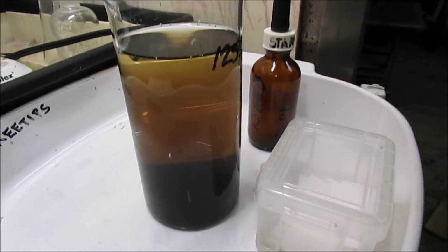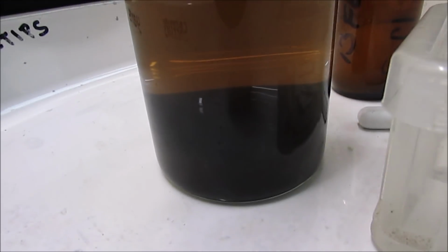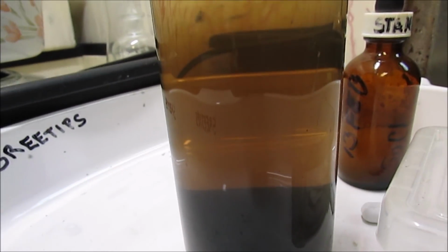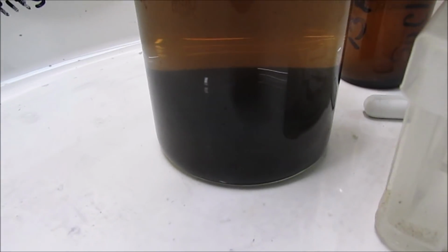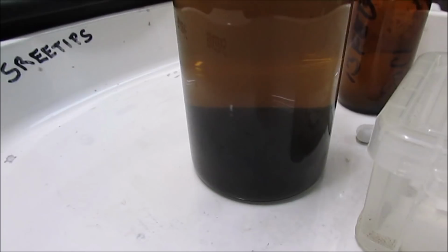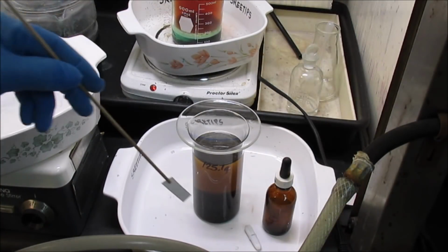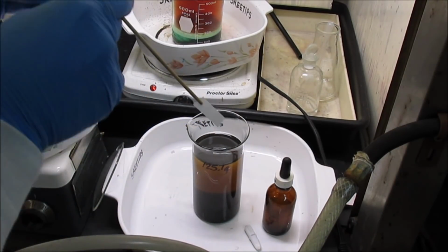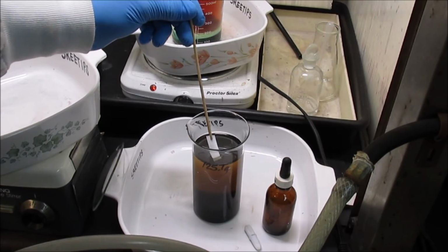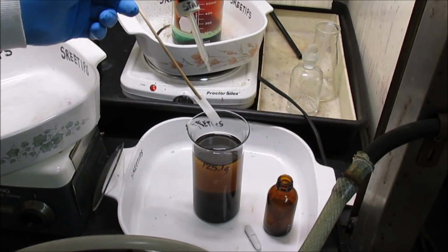I allowed this solution to settle overnight and it's got a little bit of an orange tint to the solution above the black PGM powders. I'm going to get a stannous test on that. I'm going to reach down into the jar there and get a little bit of the solution on a piece of filter paper, and then we're going to test it with stannous chloride testing solution.